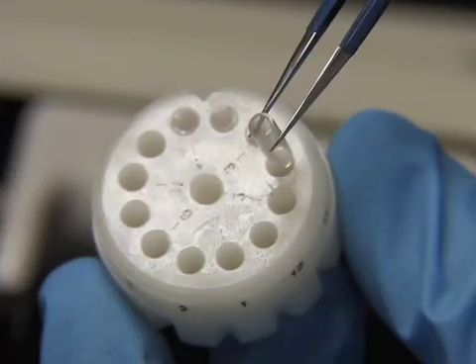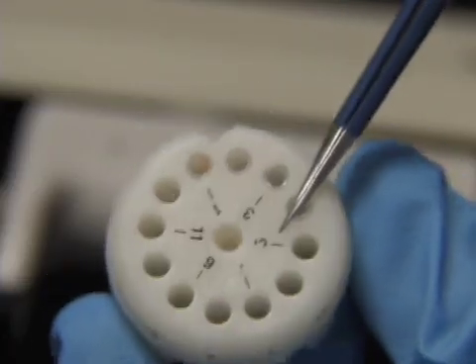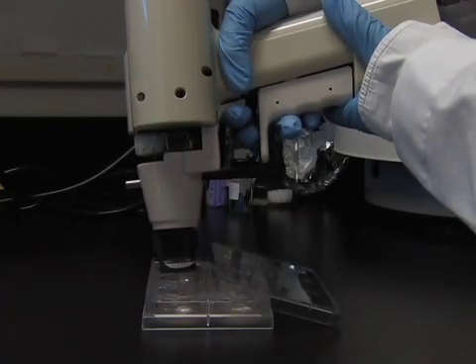Hi, I'm Georgia Woods. I'm a graduate student in the laboratory of Dr. Karen Zito at the University of California at Davis. Today I will demonstrate how to make DNA coated bullets and how to perform biolistic transfection on rat hippocampal slices.